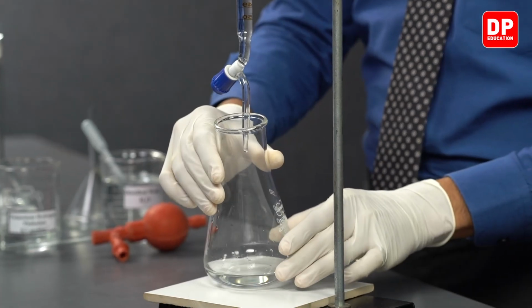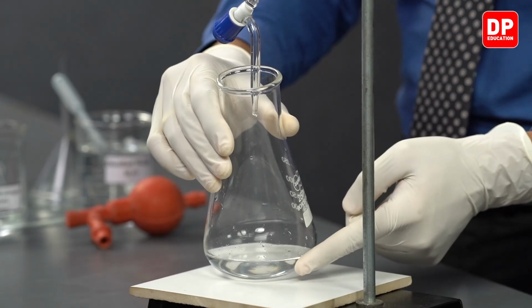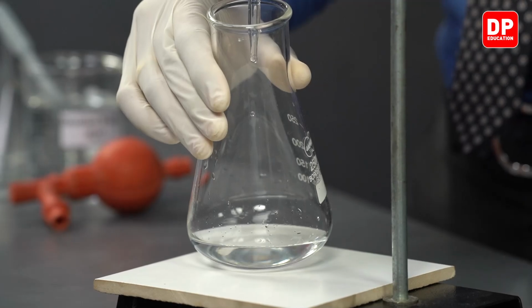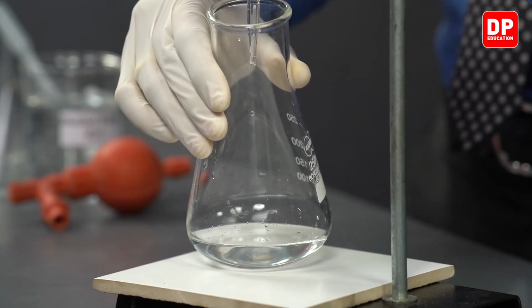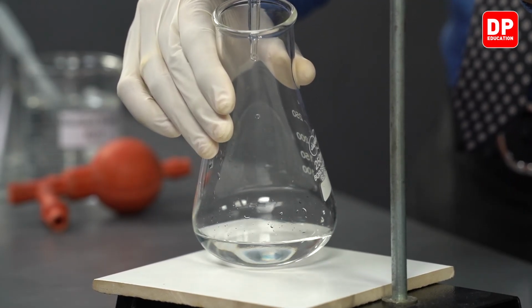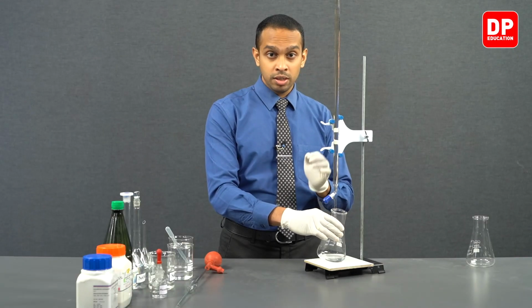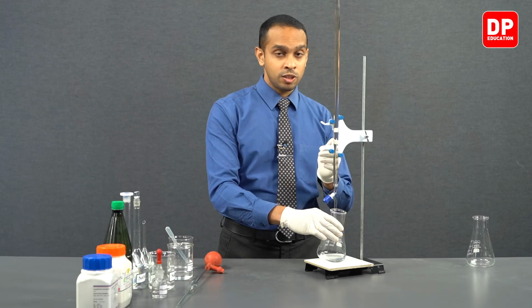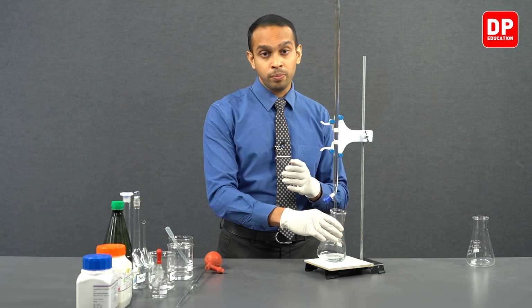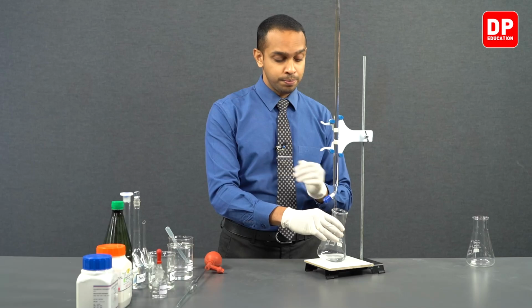Now observe, students, when I add a few drops of sodium hydroxide, almost instantly the pink color that appeared disappears. You can see upon addition of a single drop or few drops, the pink color that you observe will disappear quite fast. However, you will notice towards the end of the titration, this pink color will take some time to disappear, and with the last drop, you will observe that it will produce a persistent pink color in the solution.